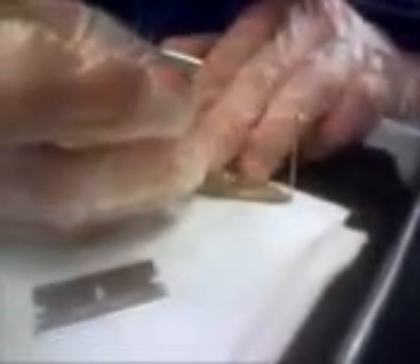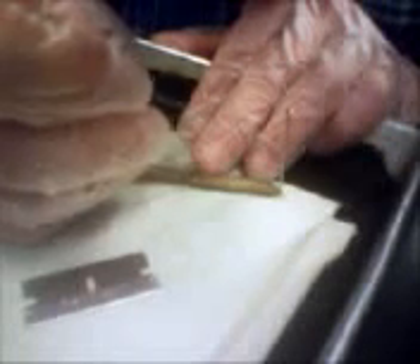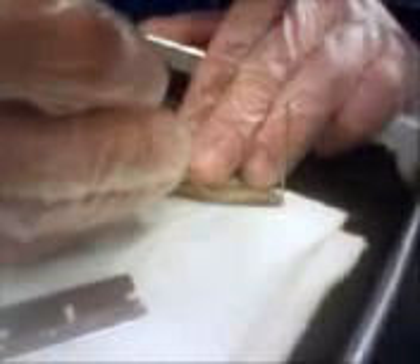Did you cut it? Yeah. Now you're going to have to slowly tear it open. You're not really cutting it, though. There. Eww, it's all watery. You're pumping it too hard. You're feeling it, though.